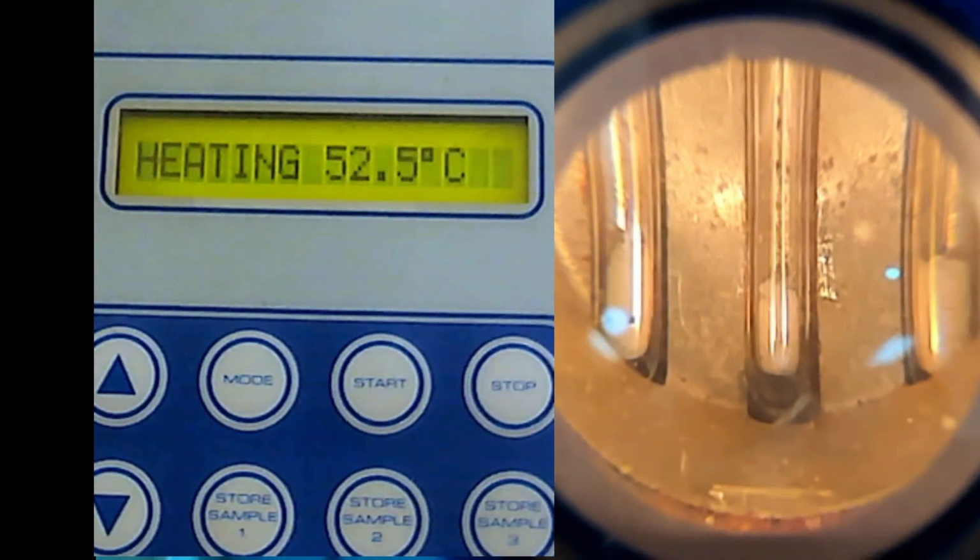So that's why typically when you are in the lab, for this type of experiment 1C, the students will normally go back home maybe like 30 minutes or 1 hour after 3 hours, because the lab itself is 3 hours, but because of this waiting game, you cannot do anything.